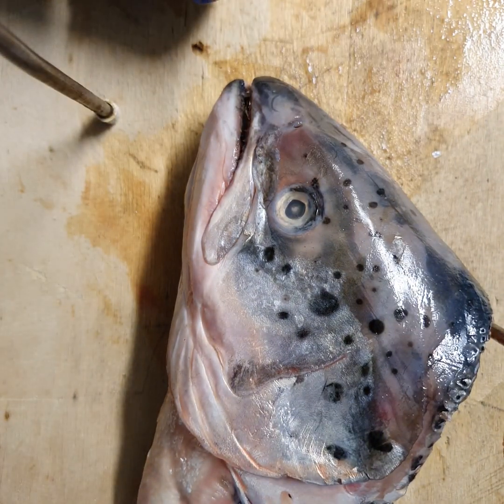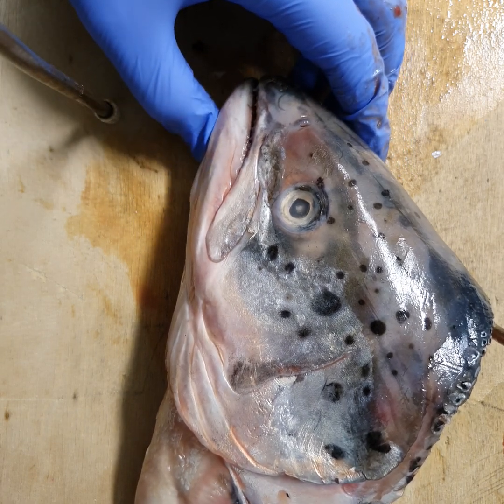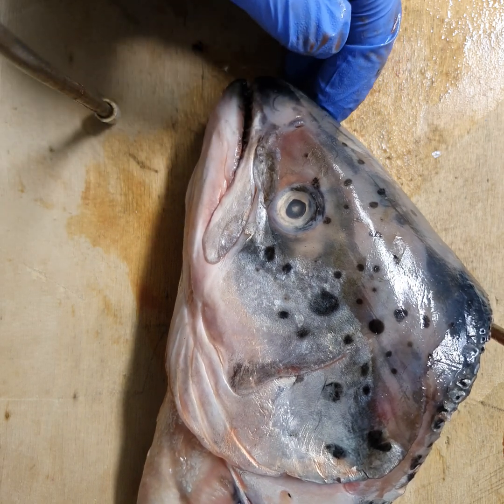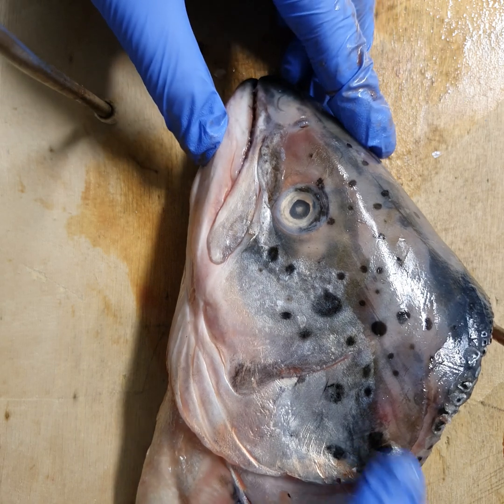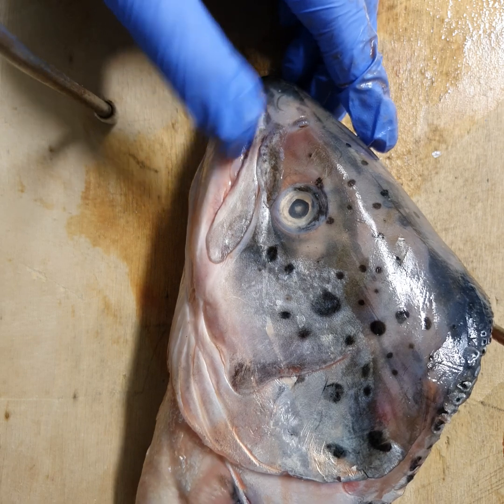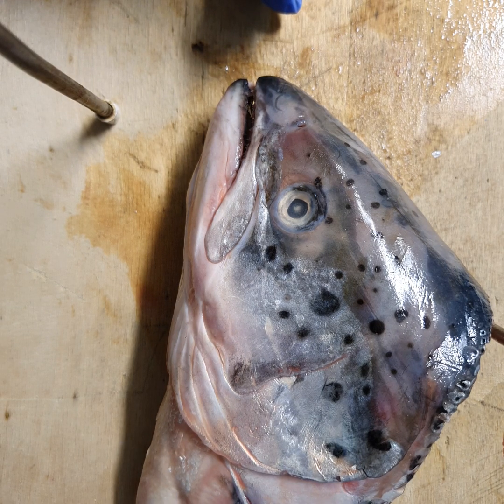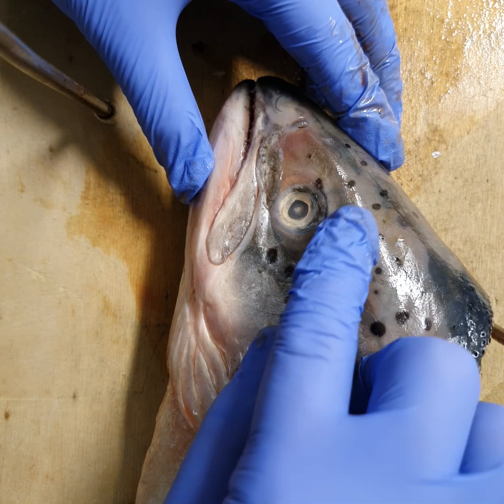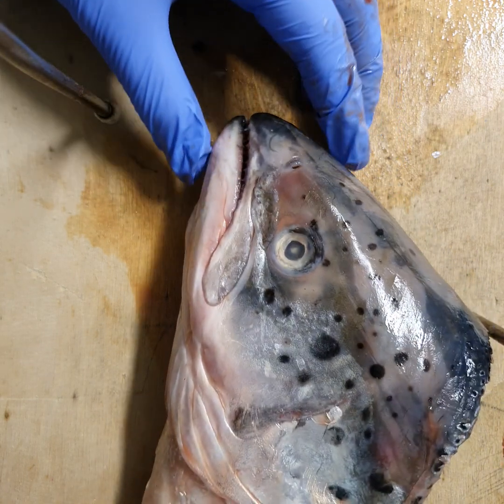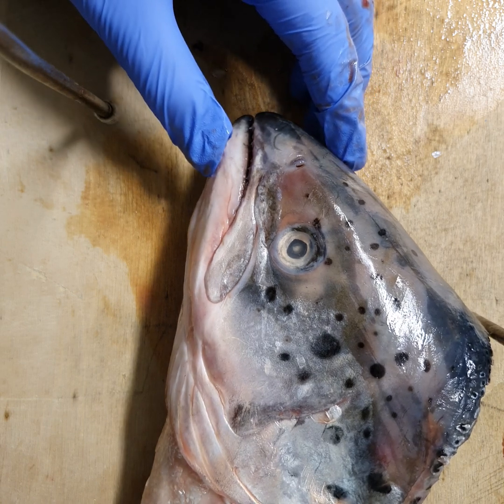Fish must ensure that water always flows in one direction over the gills. Bony fish have a sophisticated system to achieve this. More primitive cartilaginous fish such as sharks and rays need to constantly move to ensure water enters through the mouth and leaves through the gills — that is an example of ram ventilation. They constantly have to ram their way through the water. Bony fish such as salmon, however, can ensure water passes through in one direction even when remaining still.